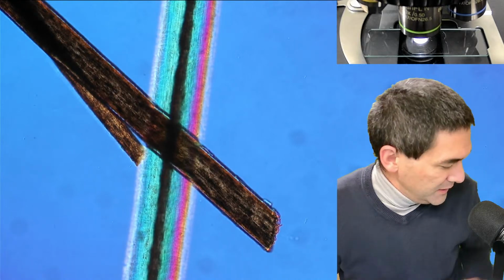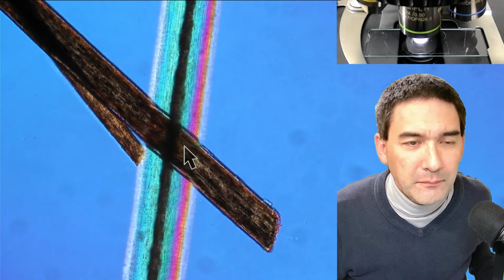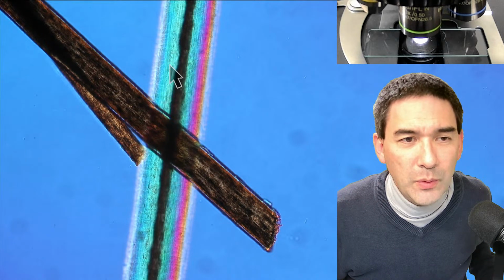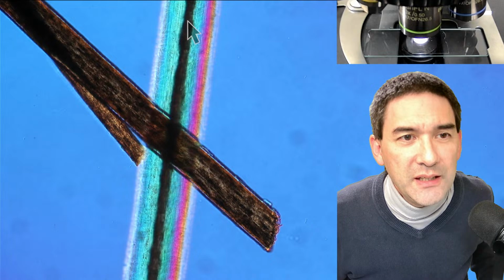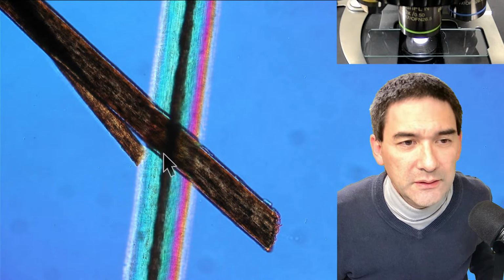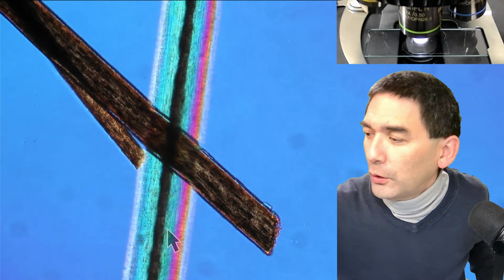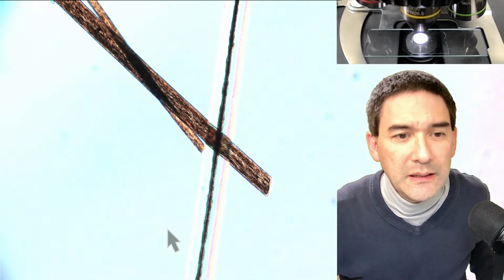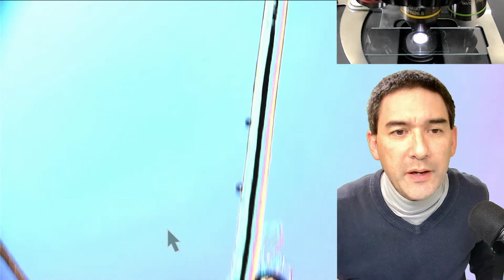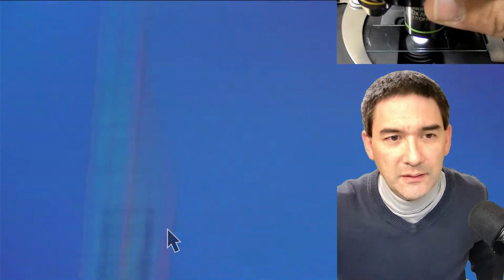Okay, so where is it? Yeah, so that's one of my black hair. And this here is one of my gray hair. And what do you notice? You see that the inside here is pretty dark. That's the so-called medulla on the inside. And here it is pretty dark, but if you follow it around a little bit, I think it's not dark everywhere. See, it's starting to become light over here. Yeah, you see this? And that's of course interesting.